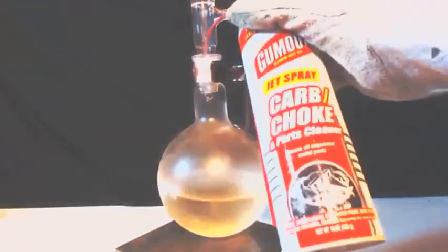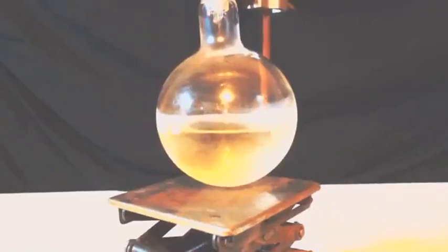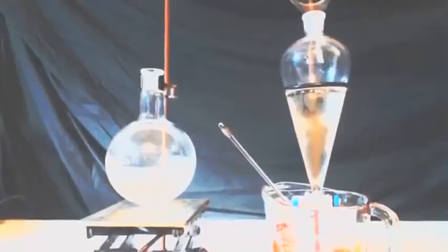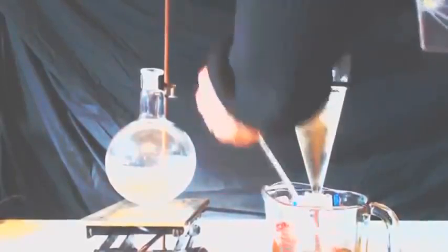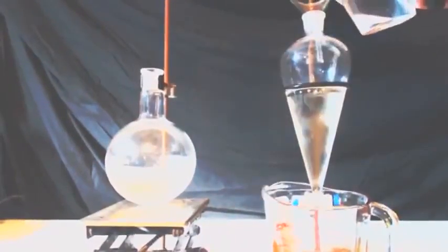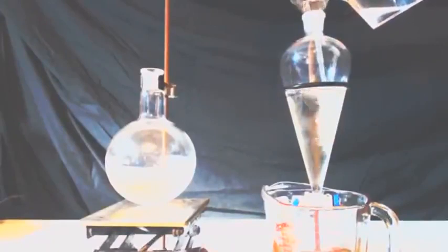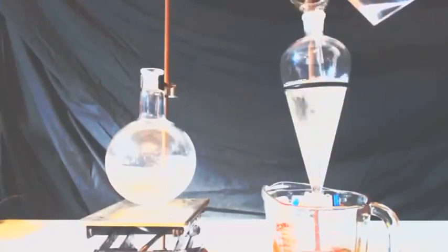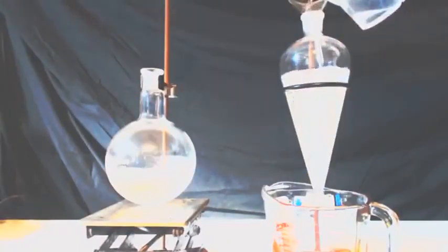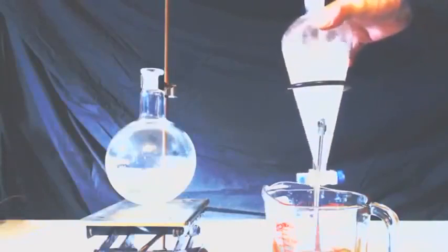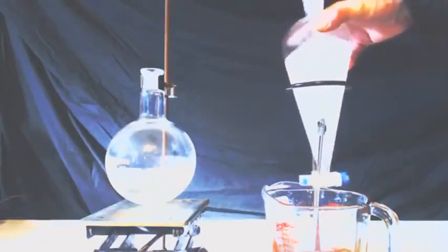So I'm basically doing the same thing here. I'm spraying the can out into the round bottom flask there. You'll notice that I only have a separatory funnel that's big enough for half of what was in the can. So to the left is half of what's in the can, and to the right I'm putting half of the can in this separatory funnel, and I'm now pouring water in there.